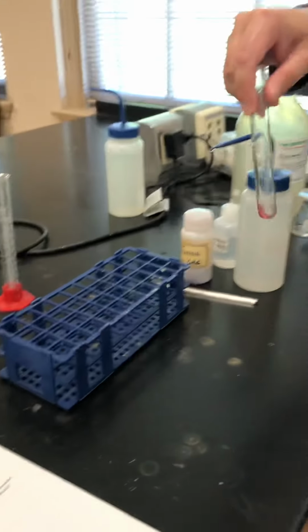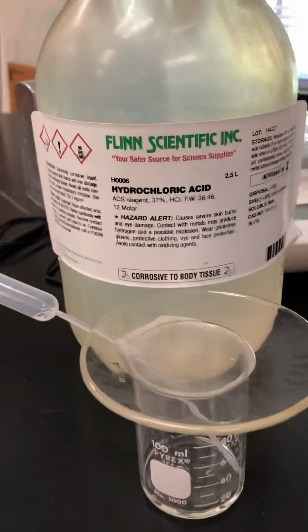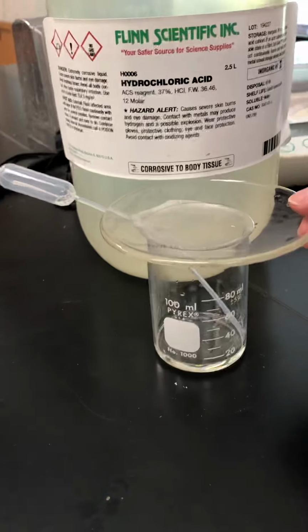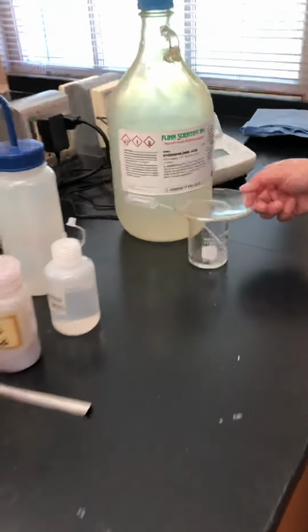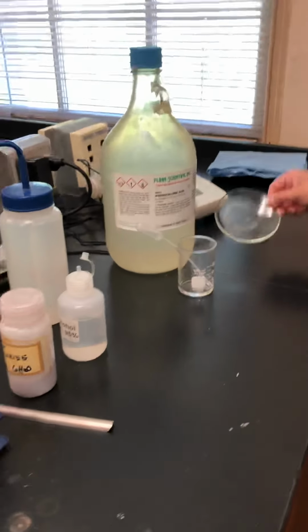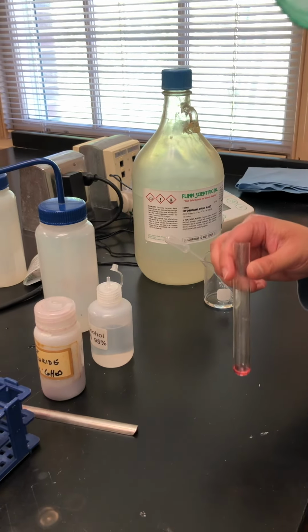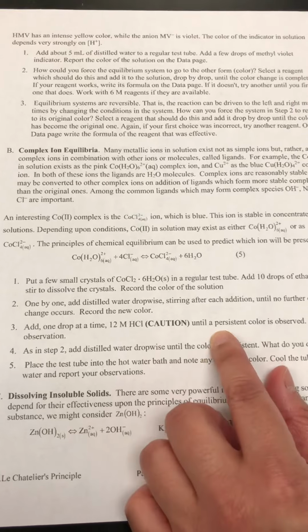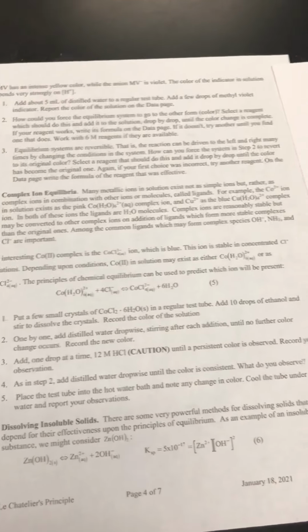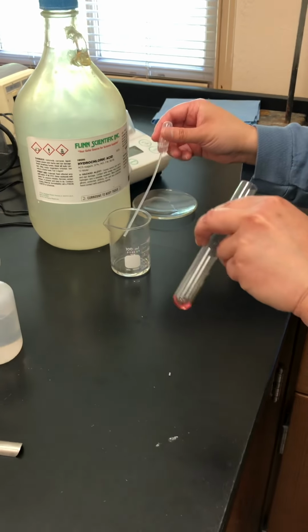Okay, and now we go over and use the heavy guns. We have here some 12 molar hydrochloric acid. We've already transferred some to a beaker, and we have this handy dandy watch glass over the top because the fumes are pretty bad and my sinuses don't need clearing. I'm just going to move that out of the way and put a few drops of this. Let me see if it says how many drops. 1 drop at a time. This stuff is pretty nasty, so I'm going to try to be careful with it and not hurt myself.